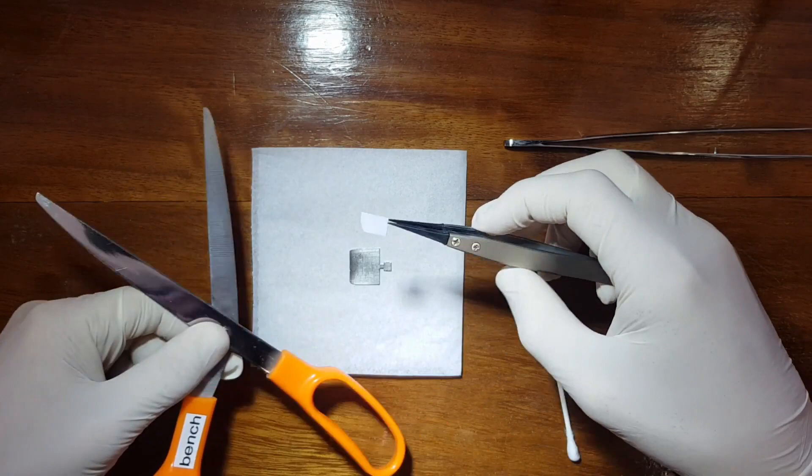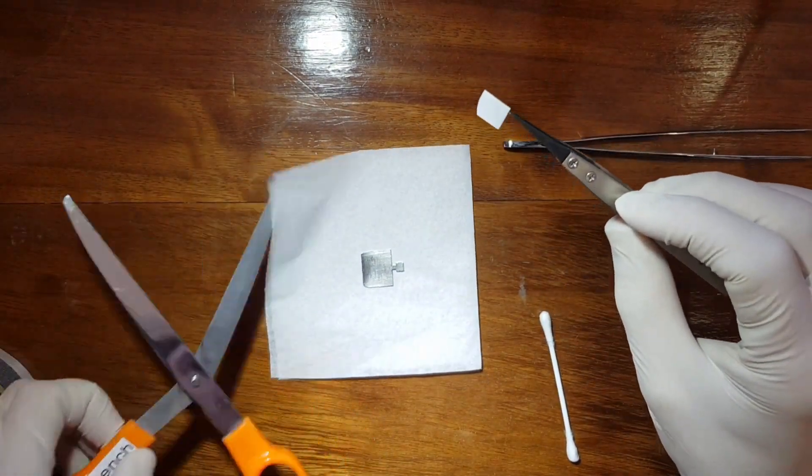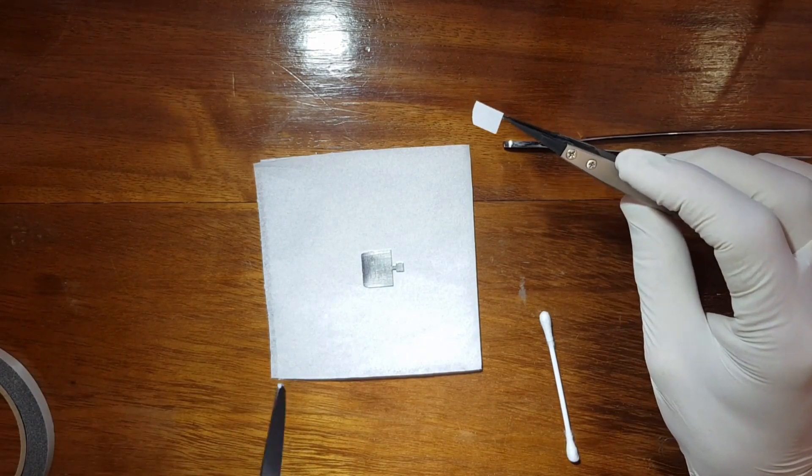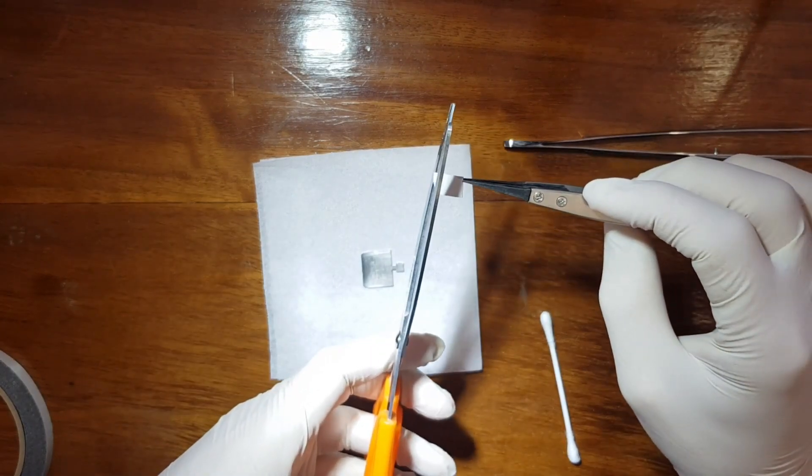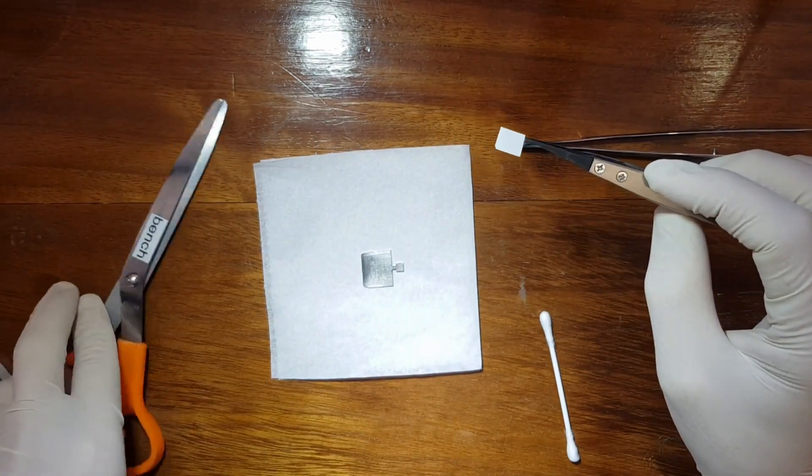There we go, pick up the sample. I've got it quite wonky there because I'm trying to illustrate it on camera, but I'll just cut it off like that.